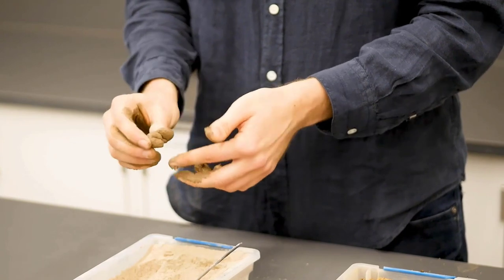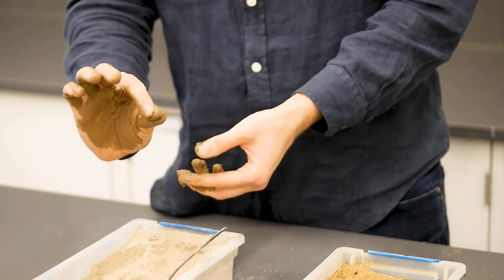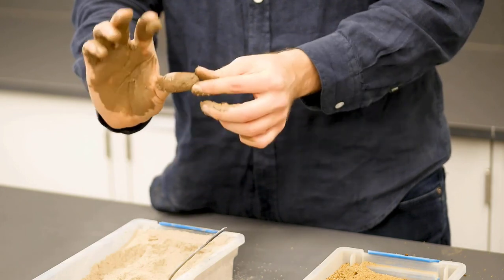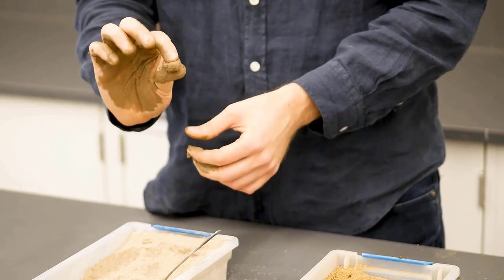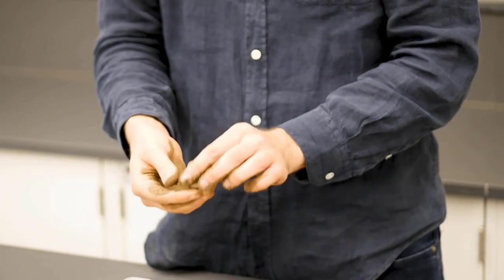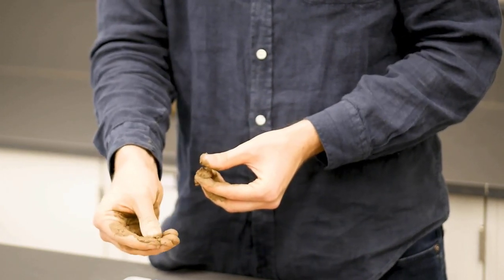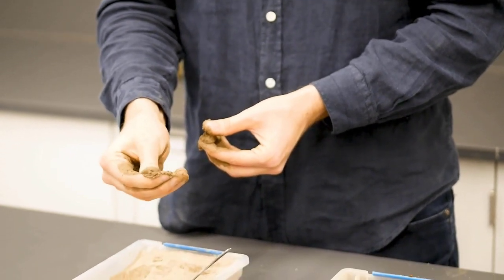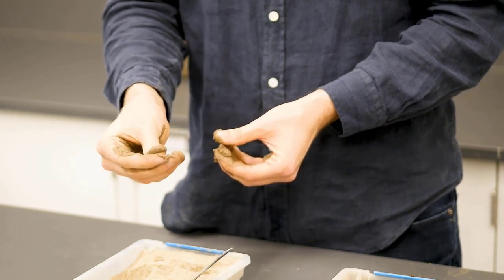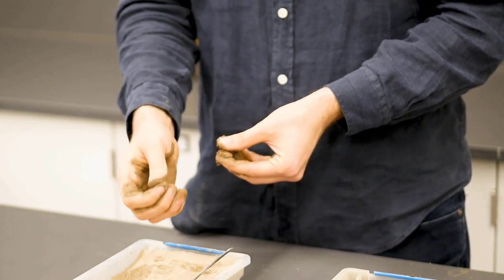Some additional considerations for determining the soil texture are the stickiness tests. You can take your soil sample and compress it between your fingers, and then when you release, you can see how much it stretches and how much sticks to your fingers. So the stickier a soil is, the more montmorillonite clay there is present. There's also the soapiness test. You can rub the sample between your fingers like this to feel for silt, which will have a slick or soapy feel to it. So the more slick and soapy, the more silt there is present in your sample.